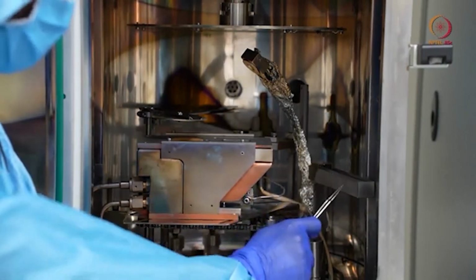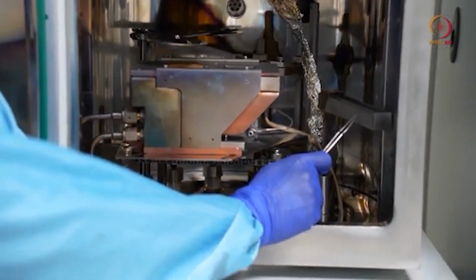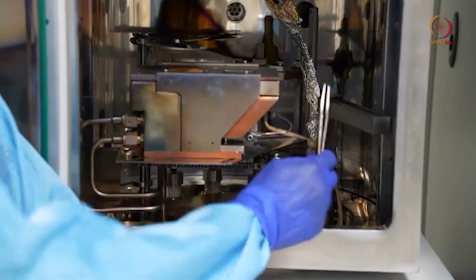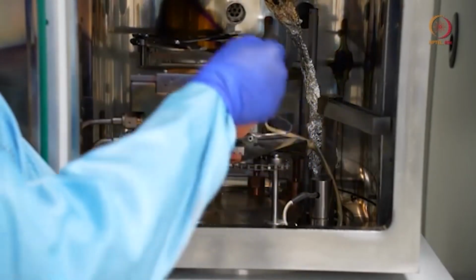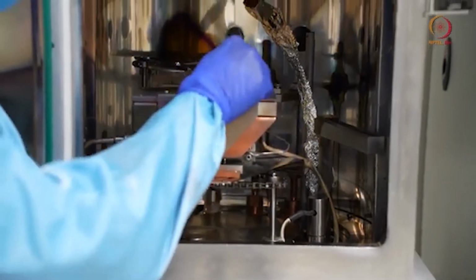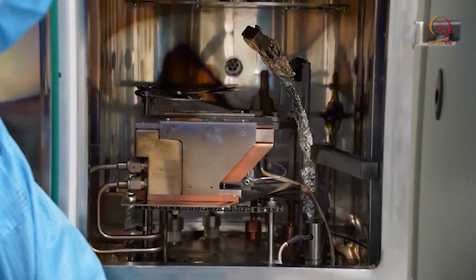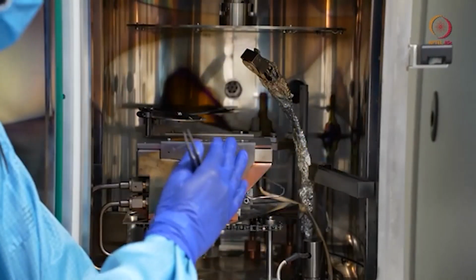And here on the right side, this facility is there to generate plasma inside for cleaning purposes. So we can generate plasma and clean the chamber inside. And on the back side you can see that is for thermal evaporation, that we will discuss in one of the upcoming modules. Here this is basically our chamber.